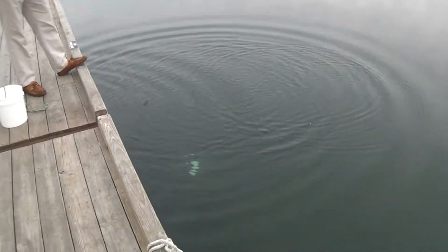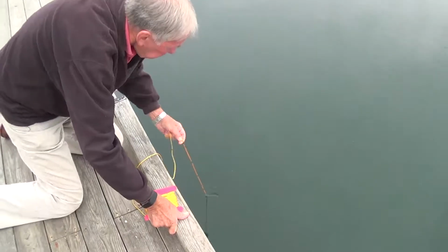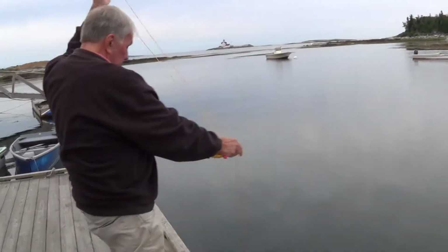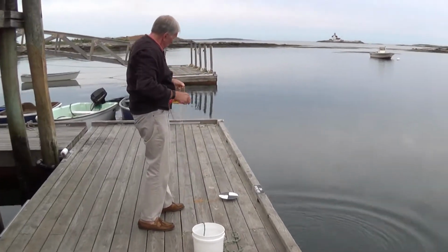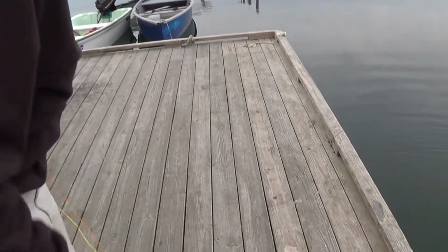So for this particular site, the water is always clear and the disc always goes to the bottom. And right now it is on the bottom. So I make this a little bit taut and I get an accurate reading. Just right there. Matter of counting to that point.